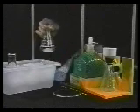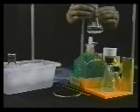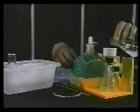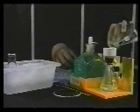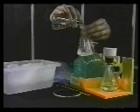Remember to wipe the crystallization flask free of water. Swirl and pour the crystals and solution onto the center of the paper. Add cold solvent and swirl the crystals remaining in the flask into the funnel.